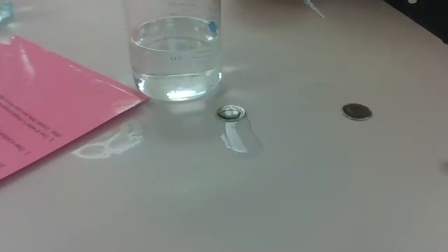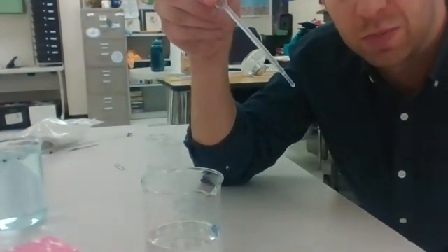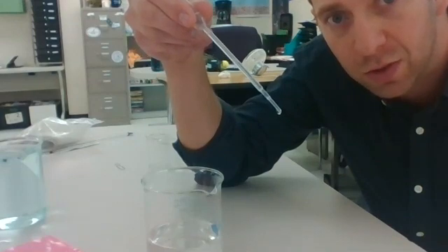Water, I got to 30, and it showed that strength of cohesion, where alcohol, I actually got more drops on that than I was expecting. It's also possible that one drop of alcohol is going to be slightly smaller than one drop of water because, again, those cohesive properties, I'm not sure if you can tell the difference.